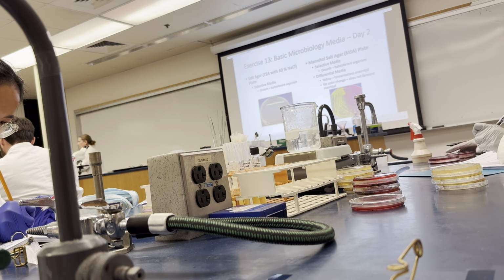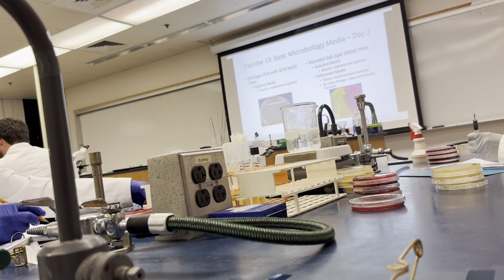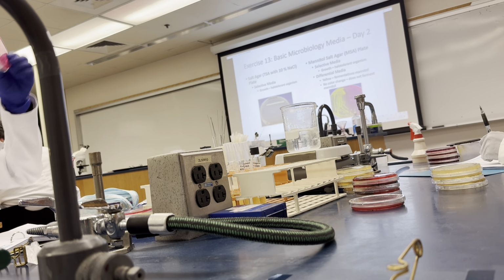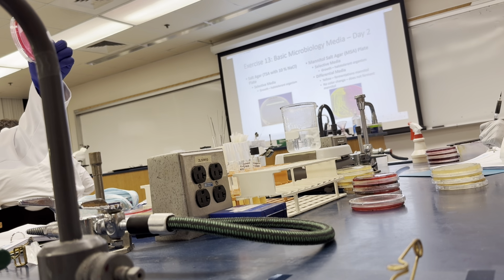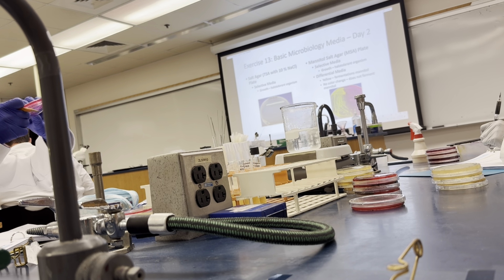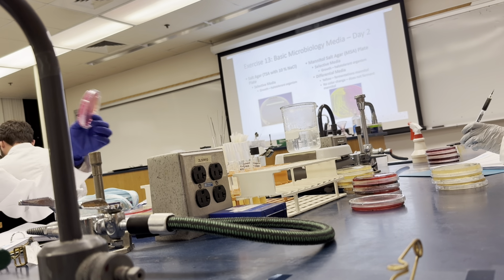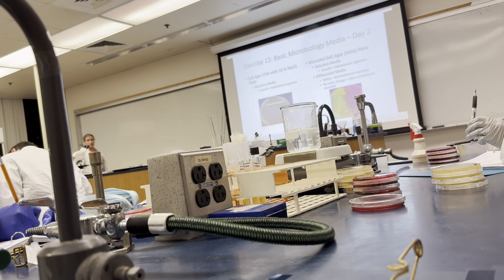Your E. coli doesn't even grow on this plate. Should it? So there had to have been an issue. What if it's just old? Then contamination. E. coli can't tolerate that high level of 7.5%. This is epidermidis. No, she said no. No, it's not. Let's go through all of them first, and I'm going to cover that.